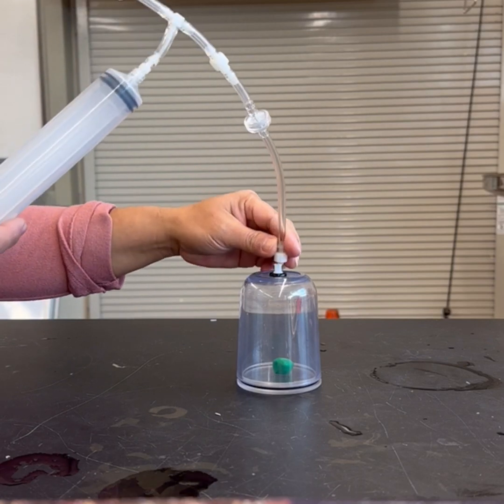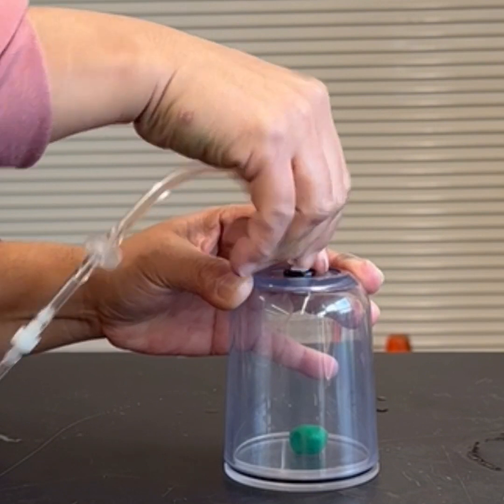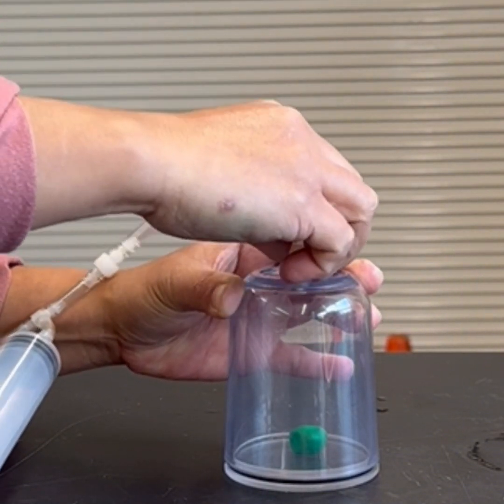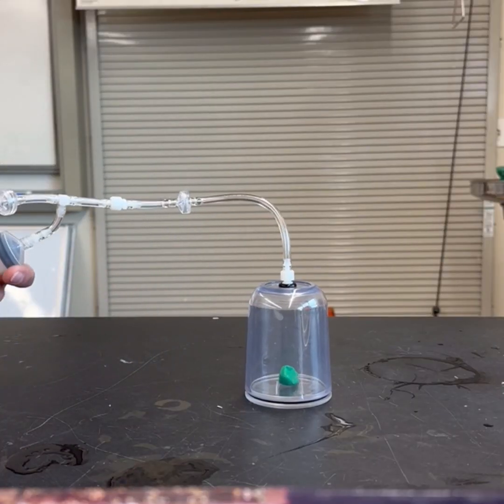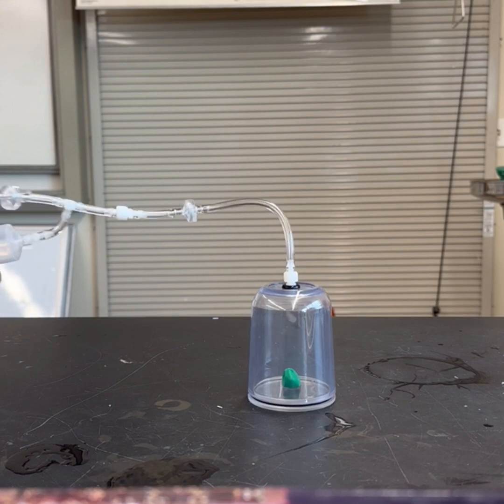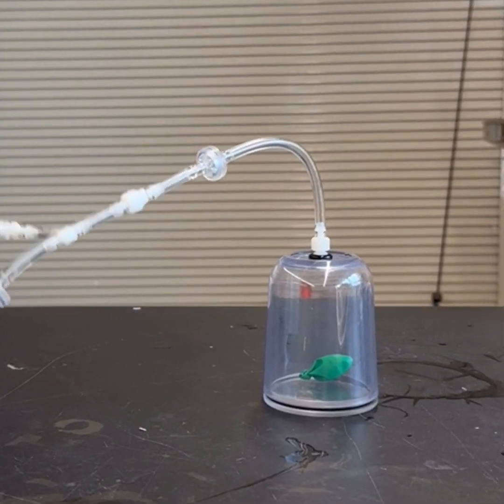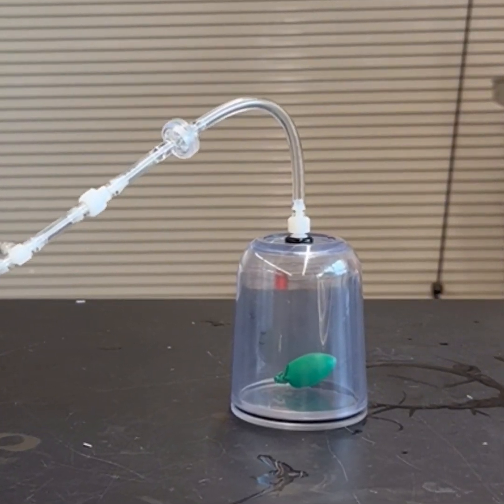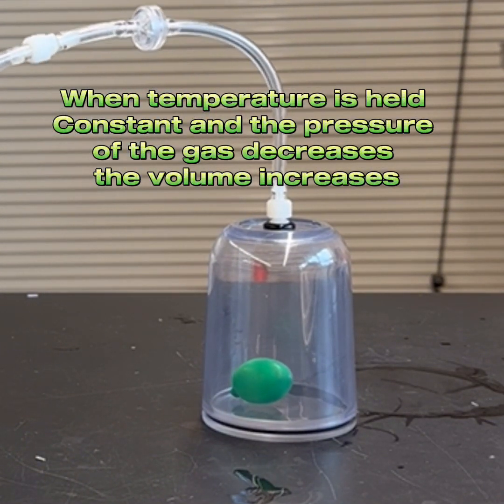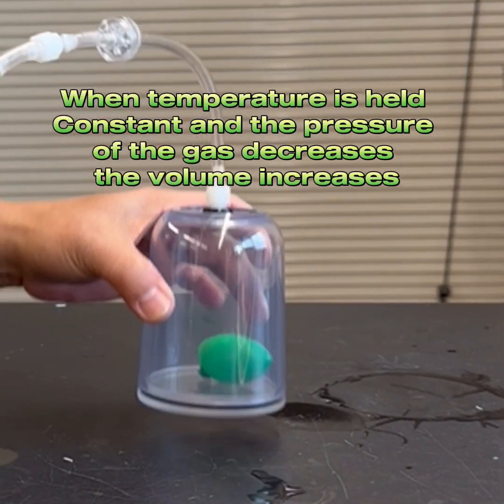Screw this in. Okay, make sure it's tight. So let's start pulling this and observe what happens to the size of the balloon. Alright, so I'm gonna start. Now you can see that the balloon is getting bigger. It's bigger.